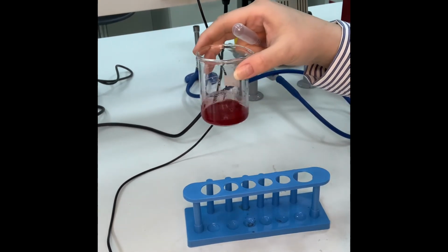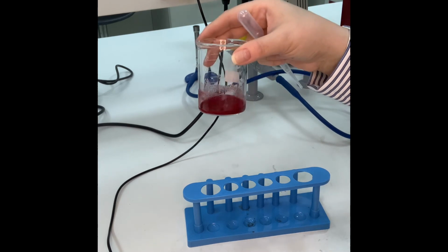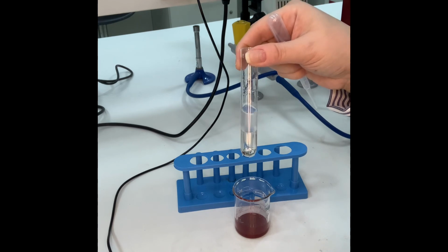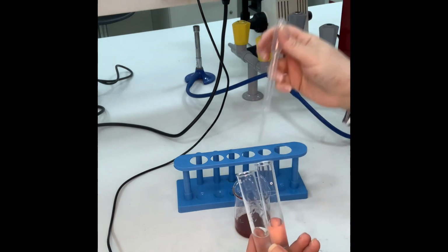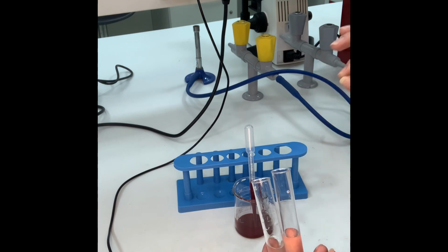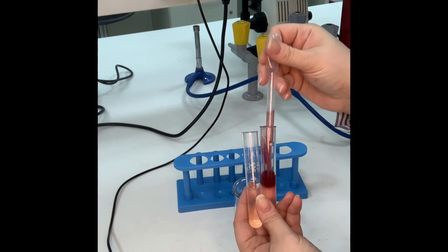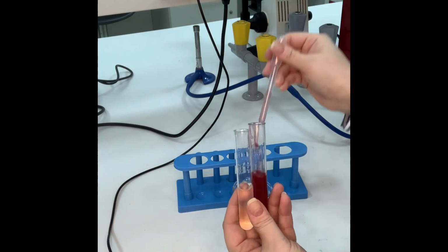Now, this is Sudan red. Okay? It has nothing to do with Sudan as a country. This is the name of the scientist, I believe, that called it Sudan. And this is a mixture of oil and alcohol, and this is water as a negative control. So I will add, as I said, Sudan red doesn't change any color, it only isolates the lipid molecules over here. So if I mix it, this is the negative control, this is the water.